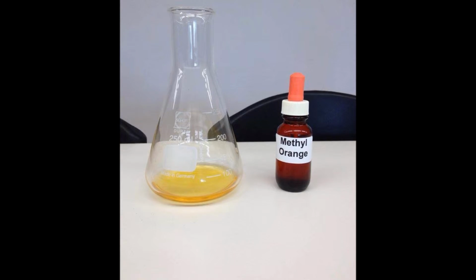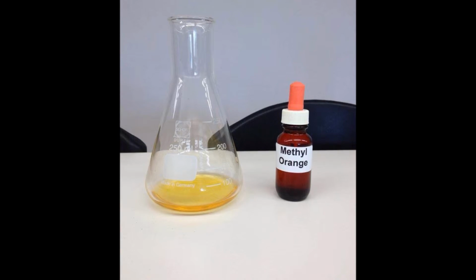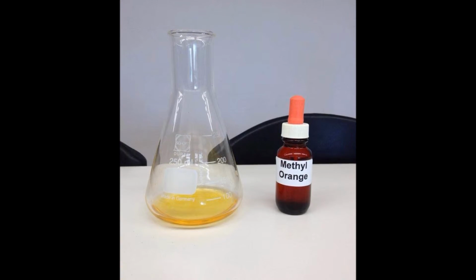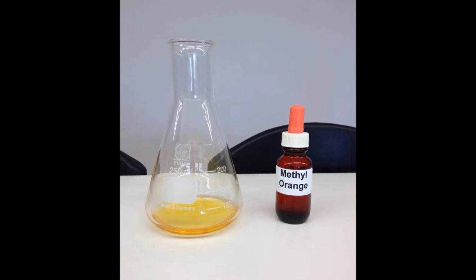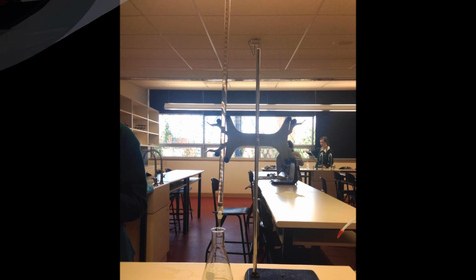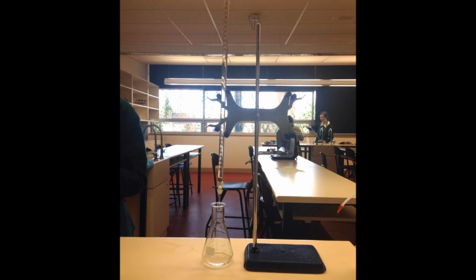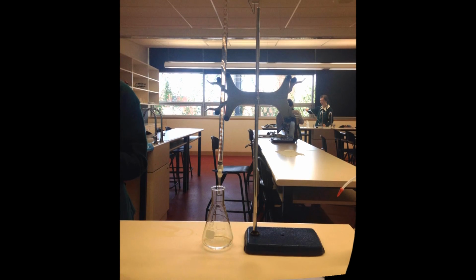Using the eyedropper, add 1 to 3 drops of methyl orange into the flask and stir using a clean, inert stirring rod. Do not add more than a few drops of indicator, as indicators themselves can affect the pH of the analyte. Once added, this will cause the solution to turn yellow. Step 5. Set up the equipment and preferably place a white towel under the flask to make it easier to detect the color change in the indicator without overshooting the equivalence point.